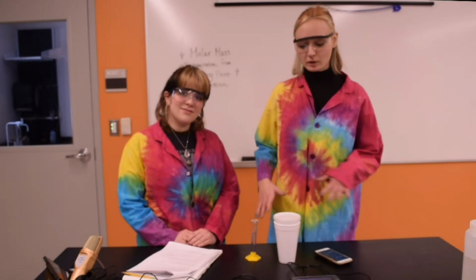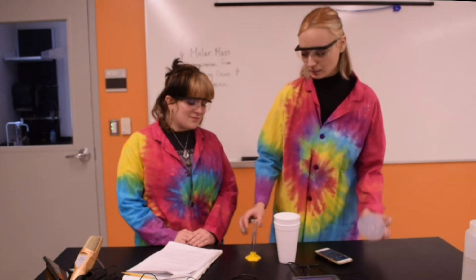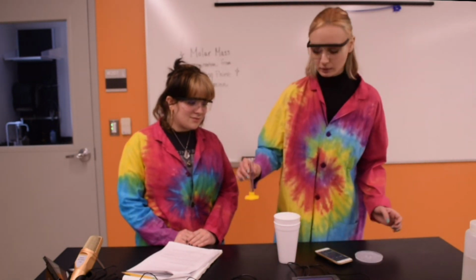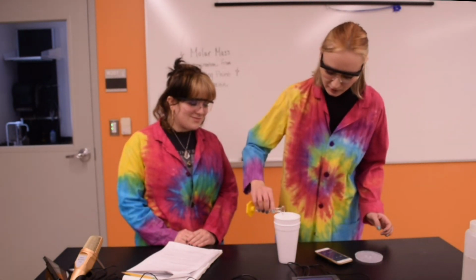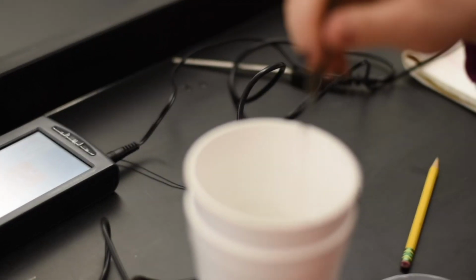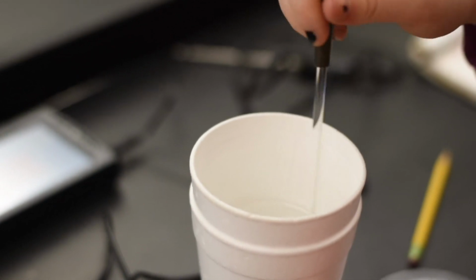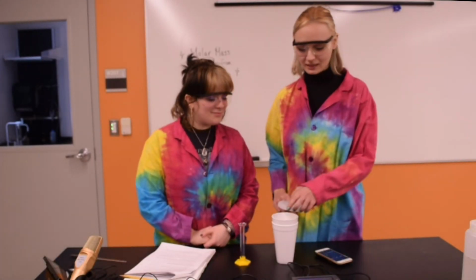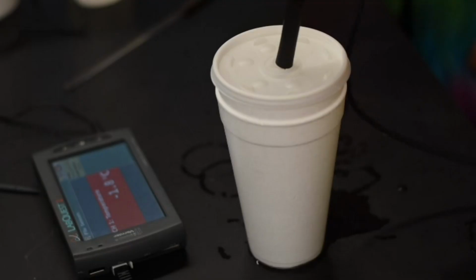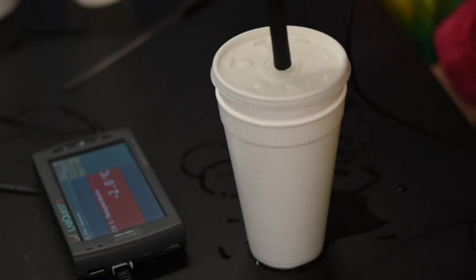So now, using the ice water mixture we did in part A, we are going to use that same thing inside the beaker here, and we're going to take that unknown liquid and pour it right on in. Just make sure that you get it all inside the beaker, not actually in the styrofoam cups. We now want to mix it for at least 60 seconds. Now that it's all mixed and done for a minute, we put the cover right back on there. And it's now time to record the new temperature.